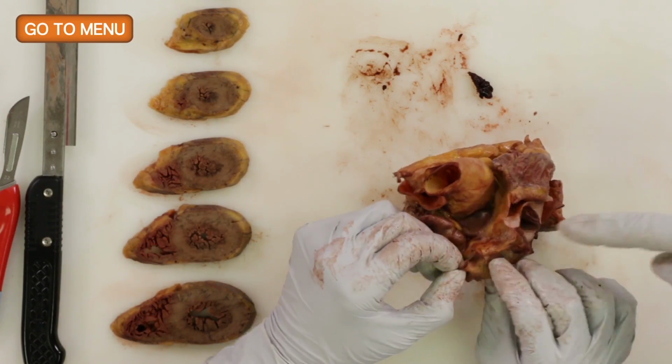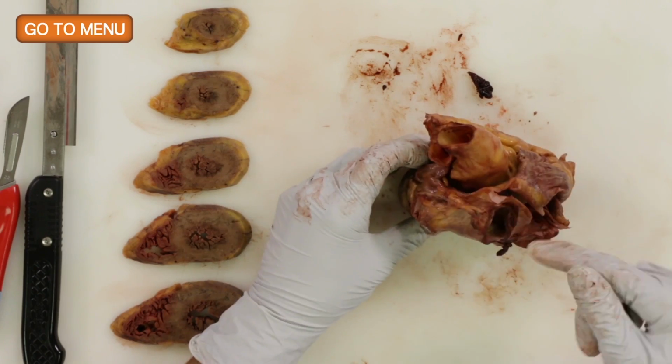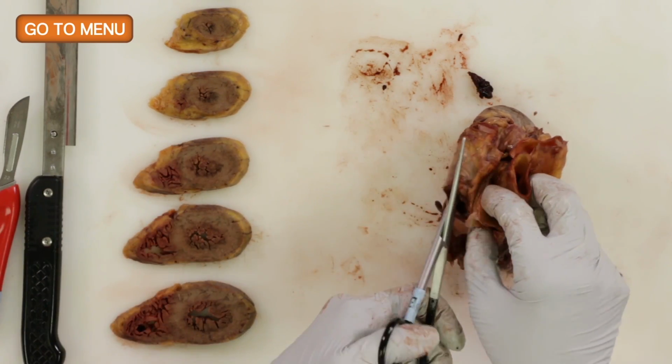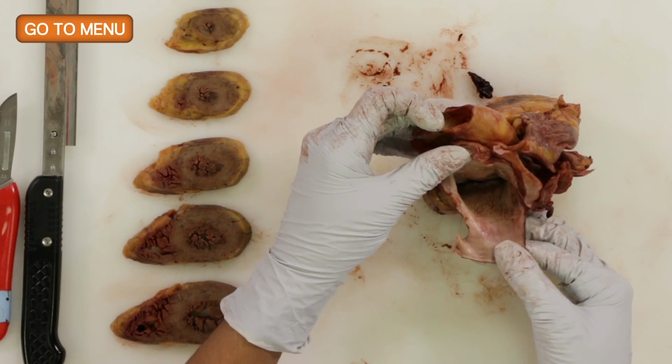There's normally 4, but this one, when it came off the pericardium, I think it lost the tissue between the 2. Yep. Right. Open it like that. So now we're looking down into the left atrium.